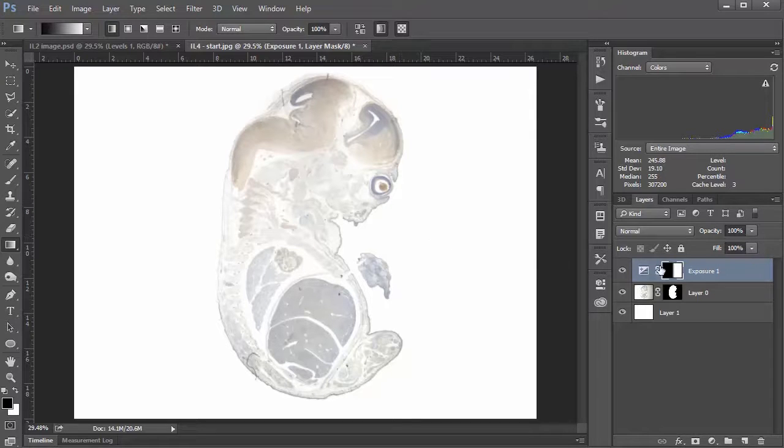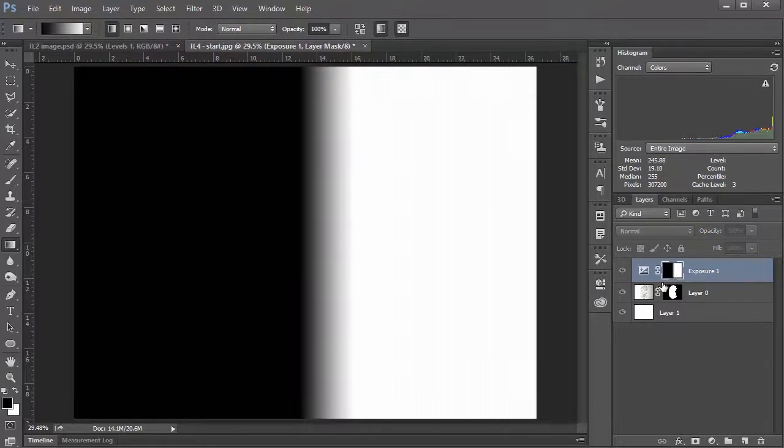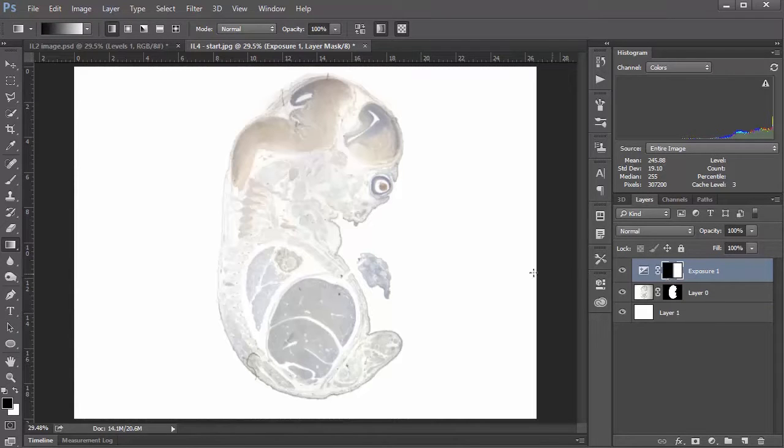And just to show you, if you hold Alt and click your layer mask here, you can see what the mask is doing. So basically, everything from the middle over onto the left-hand side is going to mask out that exposure layer, whereas everything from this gradient here to the right-hand side is going to let this exposure layer through with a nice kind of easy gradient in between. So I'll hold Alt and click that again. And so you can see now things are a little more balanced.